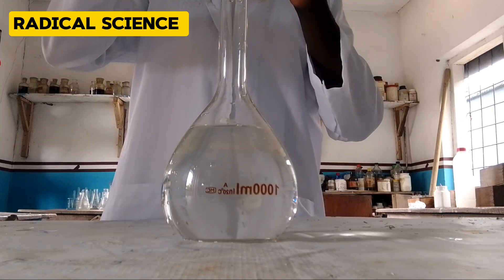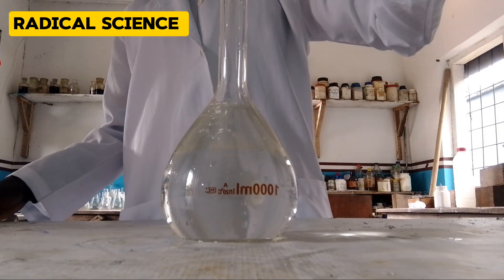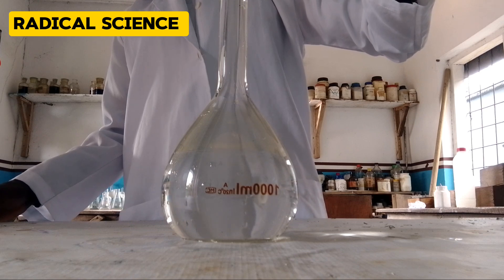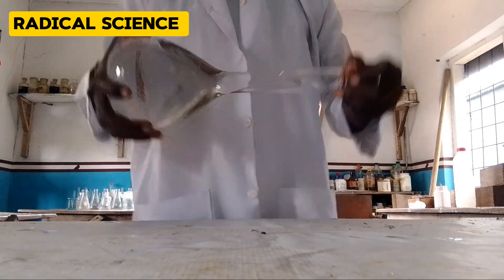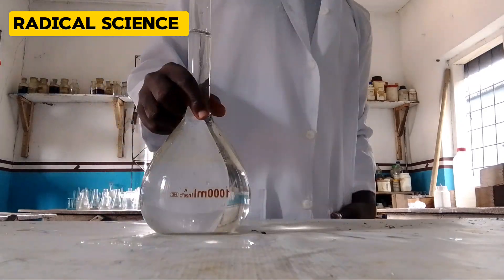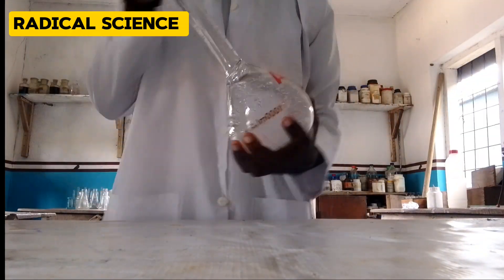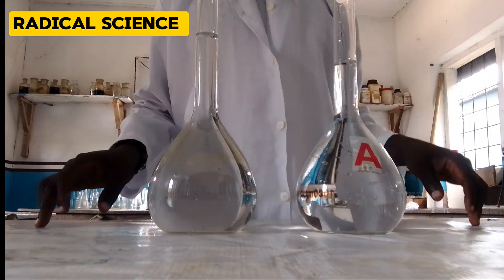I've already measured it using my weighing balance — I was able to measure 5.4 grams of sodium carbonate and I'm dissolving it in 1000 ml, which is 1 dm³. I am also preparing the acid, which is 15 ml of hydrochloric acid dissolved in 1 dm³, which is the same as 1000 ml.